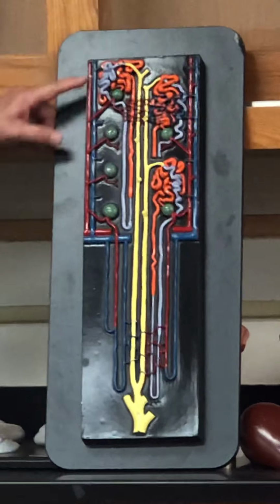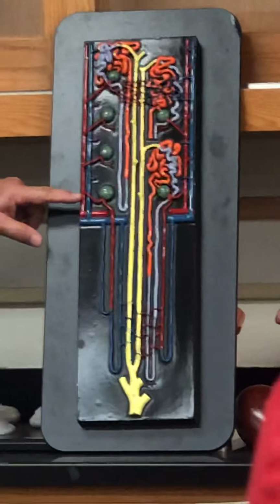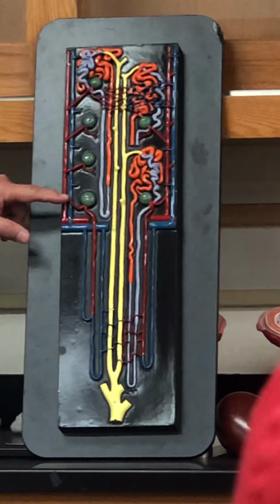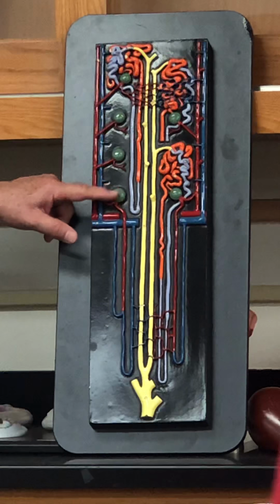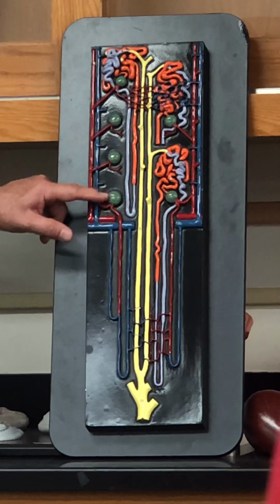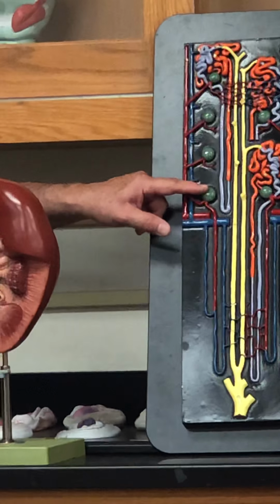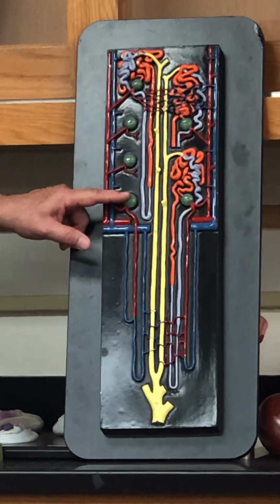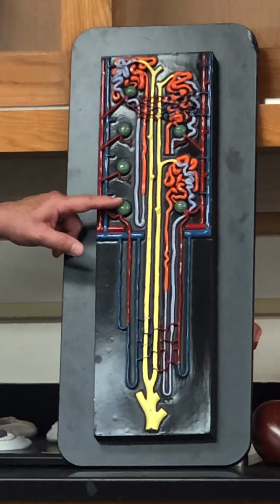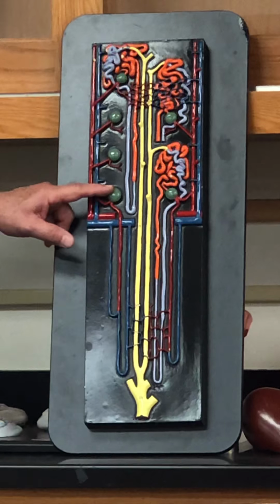Okay. So again, the radiate arteries, you can see that they're making their way. This will be a radiate artery here, and you can see that there's a radiate vein in here as well. You can see it produces this structure that makes its way into the nephron. This is one of the nephrons. What's this structure of the nephron called? The glomeruli. Bowman's capsule or renal corpuscle? You would take either of them? Either one, that's good, right?